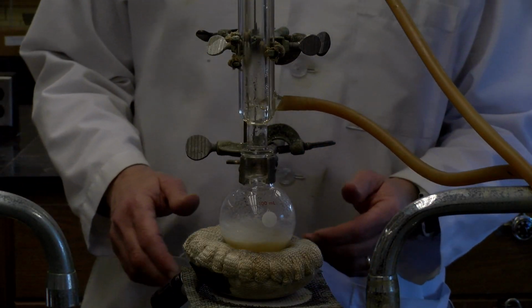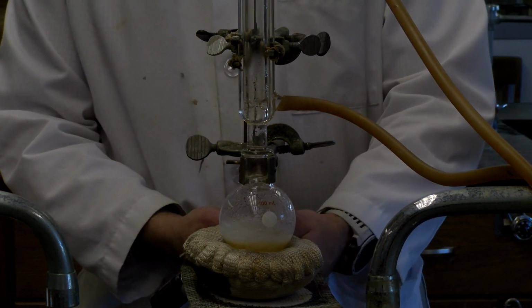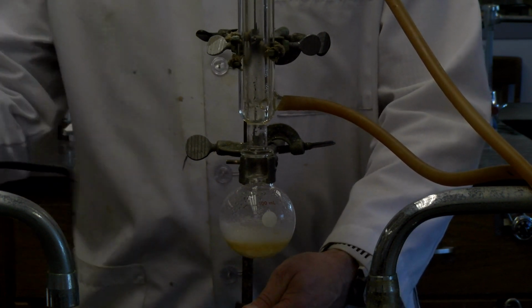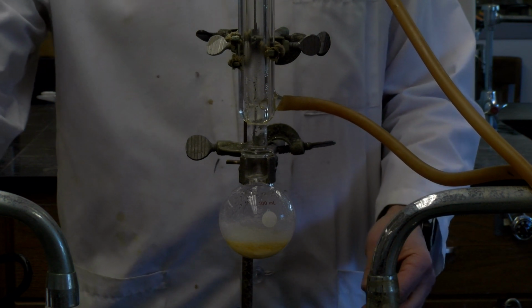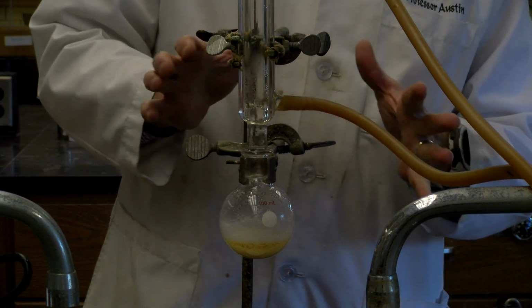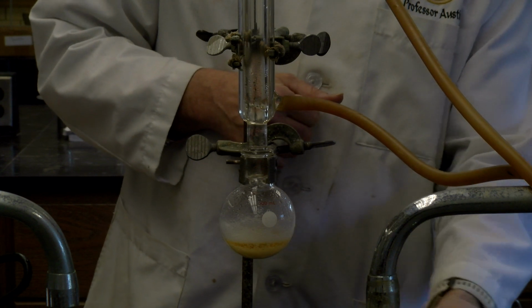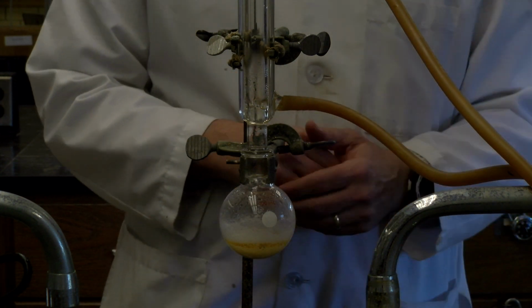So we're just over 10 minutes of heating, just barely over 10 minutes, maybe about 11. And so I'm going to stop heating here. So I think we've gotten in, so you can notice a lot of the white solid, and that is the fumaric acid that is formed. And again, we're going to let it just cool just a little bit. And again, a lot of the fumaric acid formed, the white crystals, as it was actually heating.